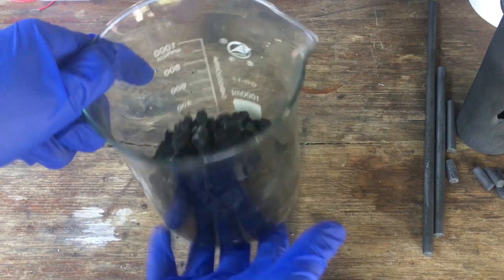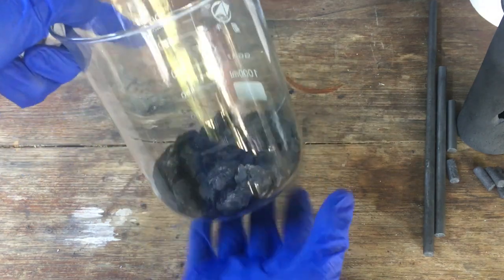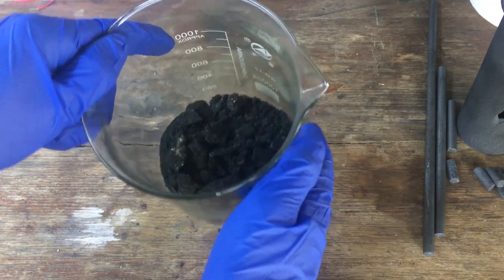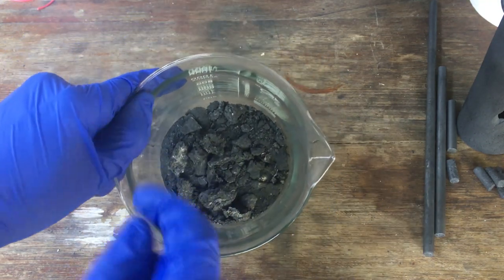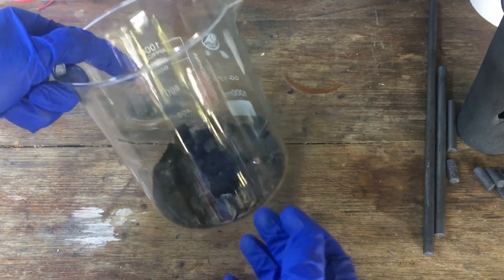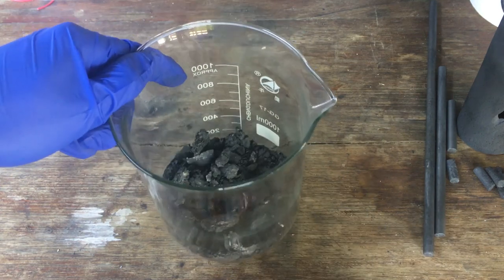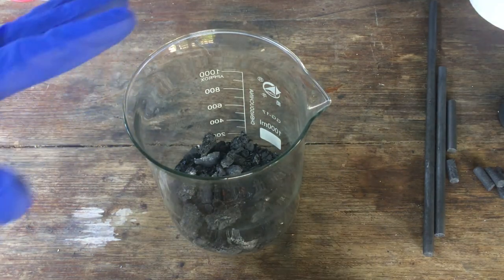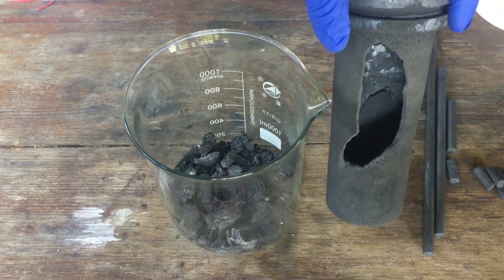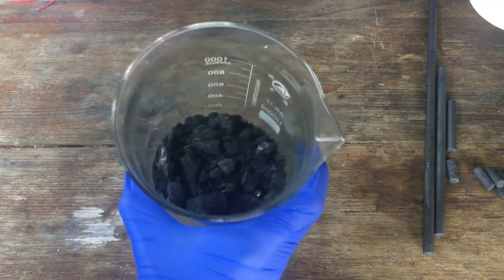And there we go — that is all of the oxide that we've decomposed in our furnace. Hopefully that is everything from the electrode materials split into its component oxides. There's no real way to tell until we try to dissolve it up. It's also probably mostly graphite in there — you notice the black colouring. There will be graphite from the crucible, graphite from the electrodes, and graphite from wherever else it might come from. I almost got it out of the crucible without breaking it, but sadly we've had a casualty there. Very disappointing, but I do really want the lithium, so it's not too bad.